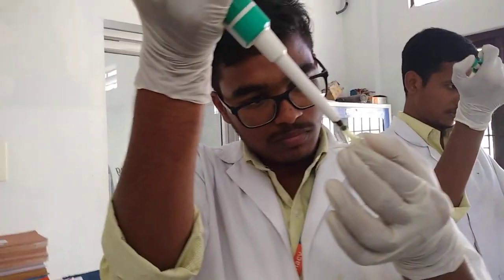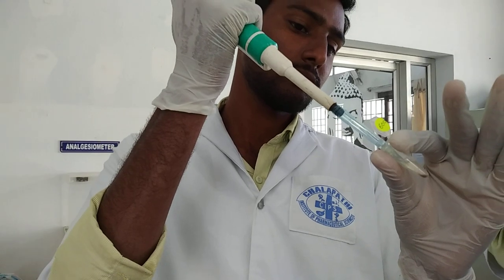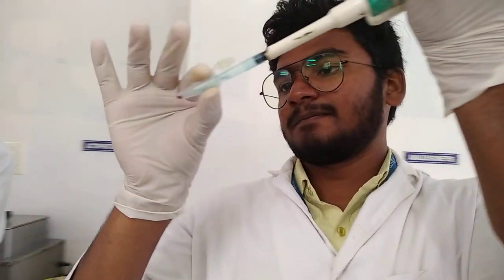Nose height — watch the tip, tube bottom point. Where is the tube bottom? Watch it. At nose height, clearly visible to you.